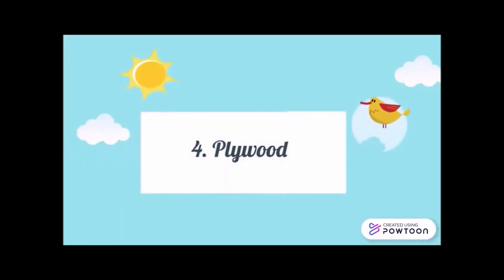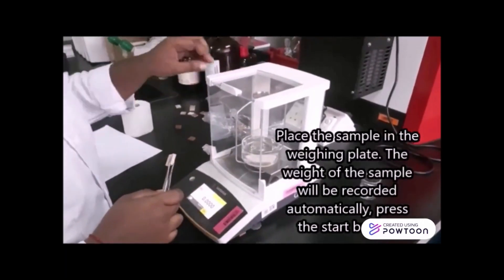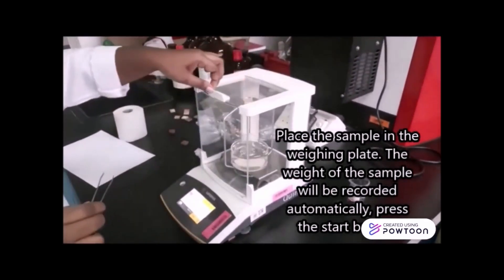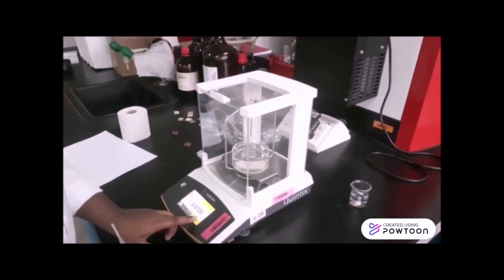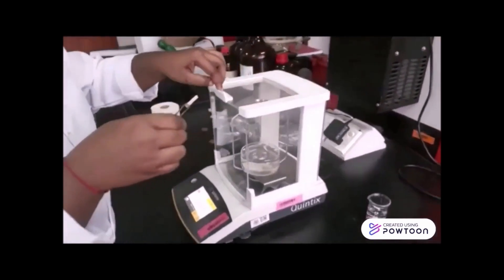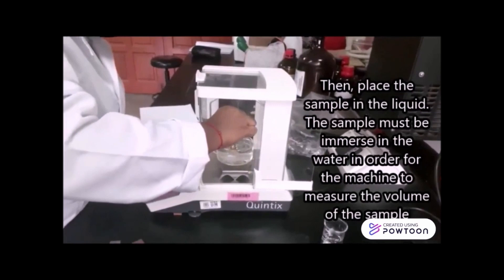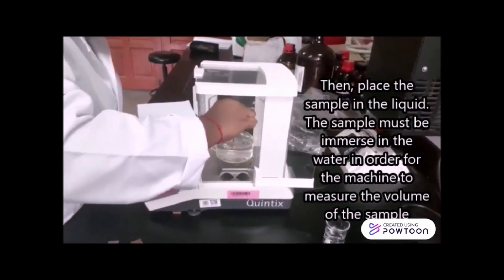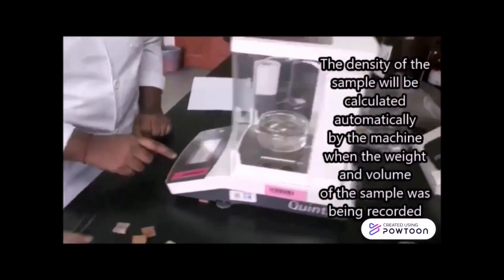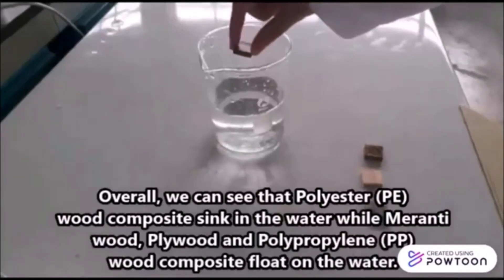Now we have reached the last sample, which is plywood. Place the sample on the weighing plate and the weight of the plywood will be recorded automatically after we press the start button. Remove the plywood and place it in the liquid. We must ensure that the sample is fully immersed in the water to get an accurate volume. After the weight and volume are recorded, the density of the sample will be calculated by the machine.